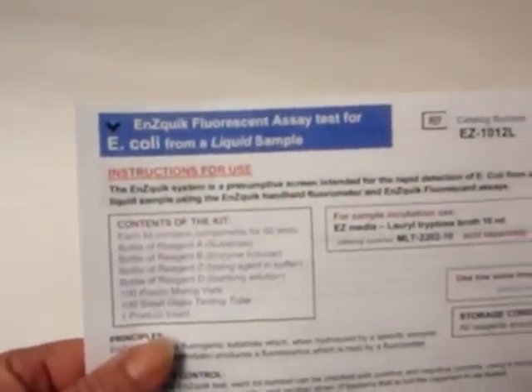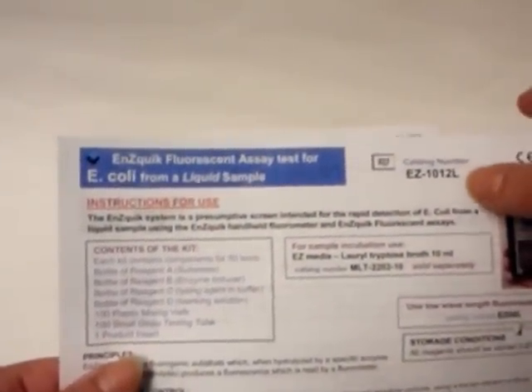Shall we begin? Be sure and use the correct kit and product insert for the type of sample you will be testing. For instance, if you are testing water or other liquid samples, you will need to use the kit which contains the letter L for liquid in the product code.